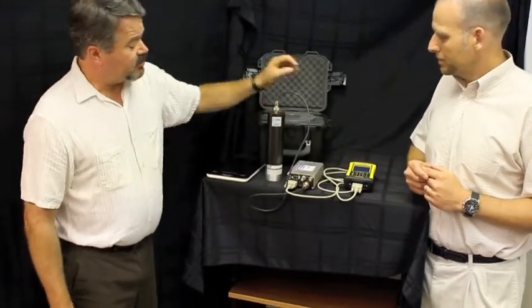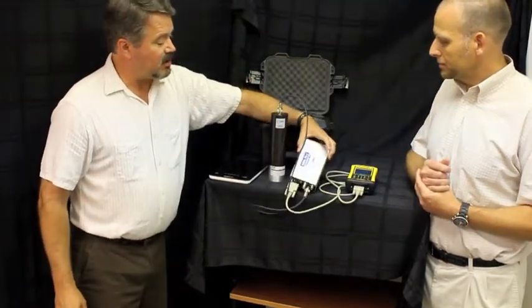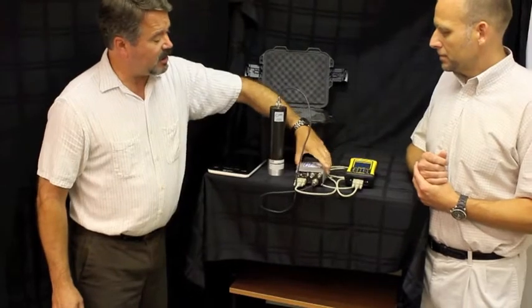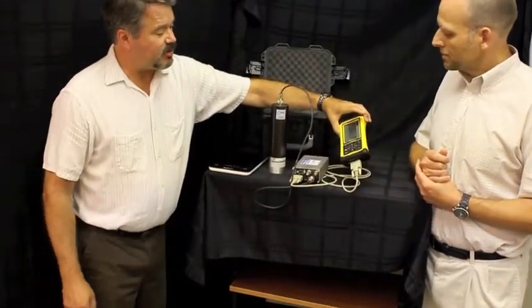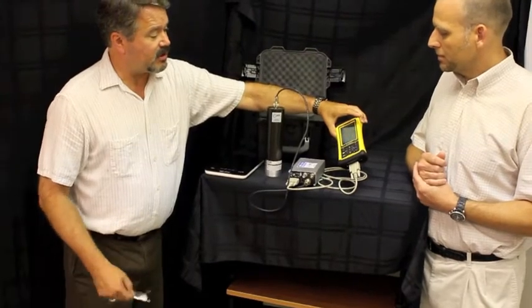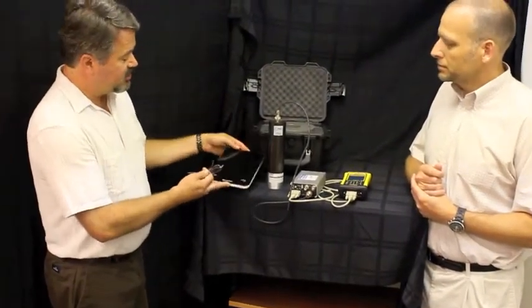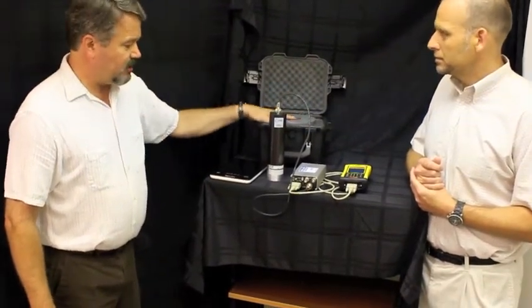The Model 970X, this is a multi-channel analyzer from Berkeley Nucleonics, and a mobile PC. In this instance that we're using today, this is a Trimble brand Nomad using Windows Mobile 6.1 version firmware. We also have a small kitchen scale and of course a lead shield for minimizing the effect of activity from normal background materials.